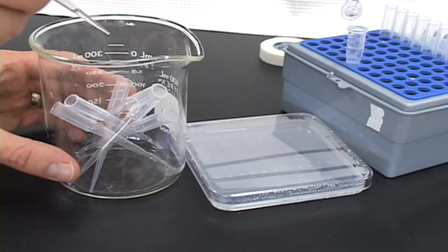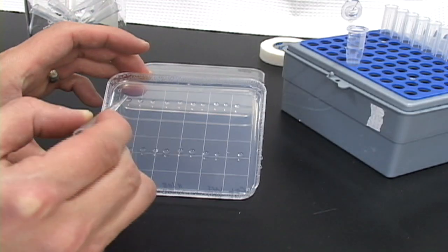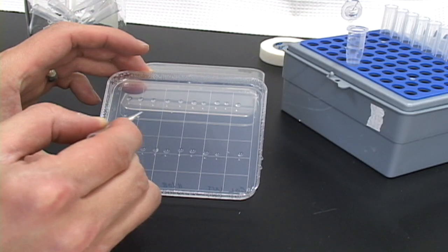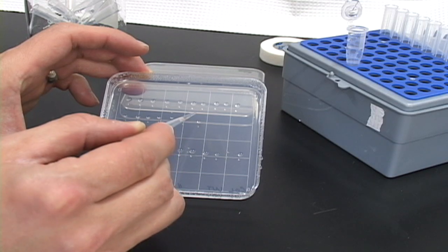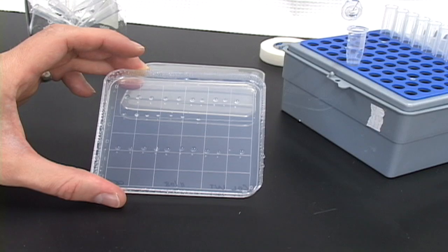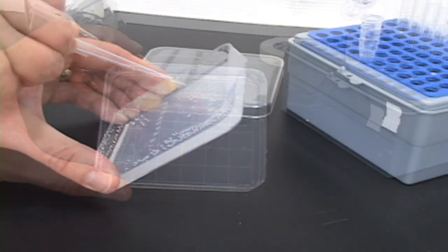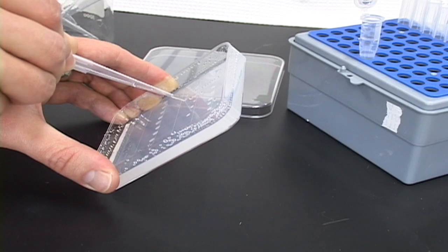Here's a demonstration of how the tip will drain if held too far from horizontal. However, keeping the plate at a slight angle and the pipette tip horizontal will allow just the right amount of flow to cause one drop to cling to the agar surface. From the side view, you can see the angle of the plate and pipette tip.